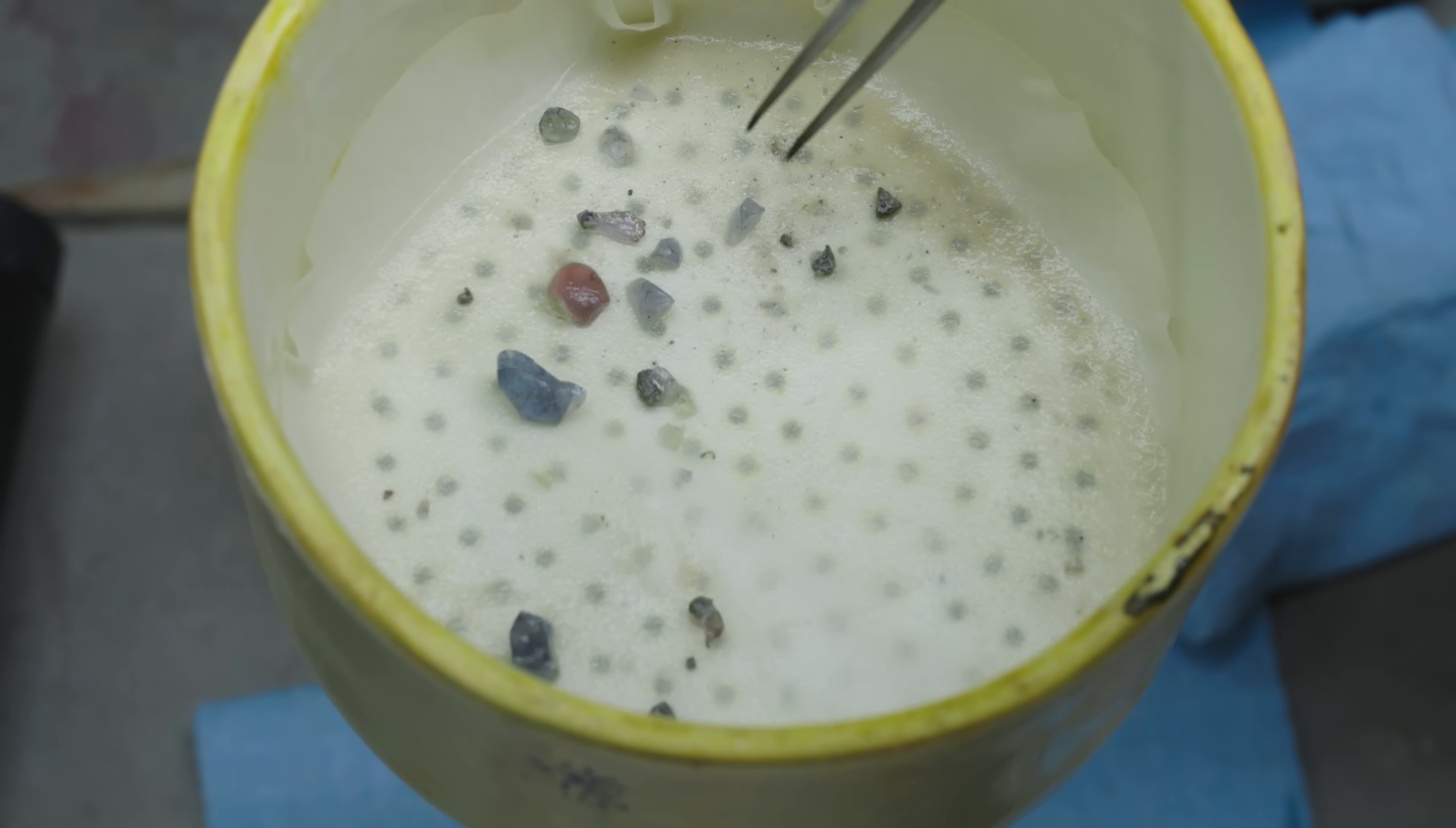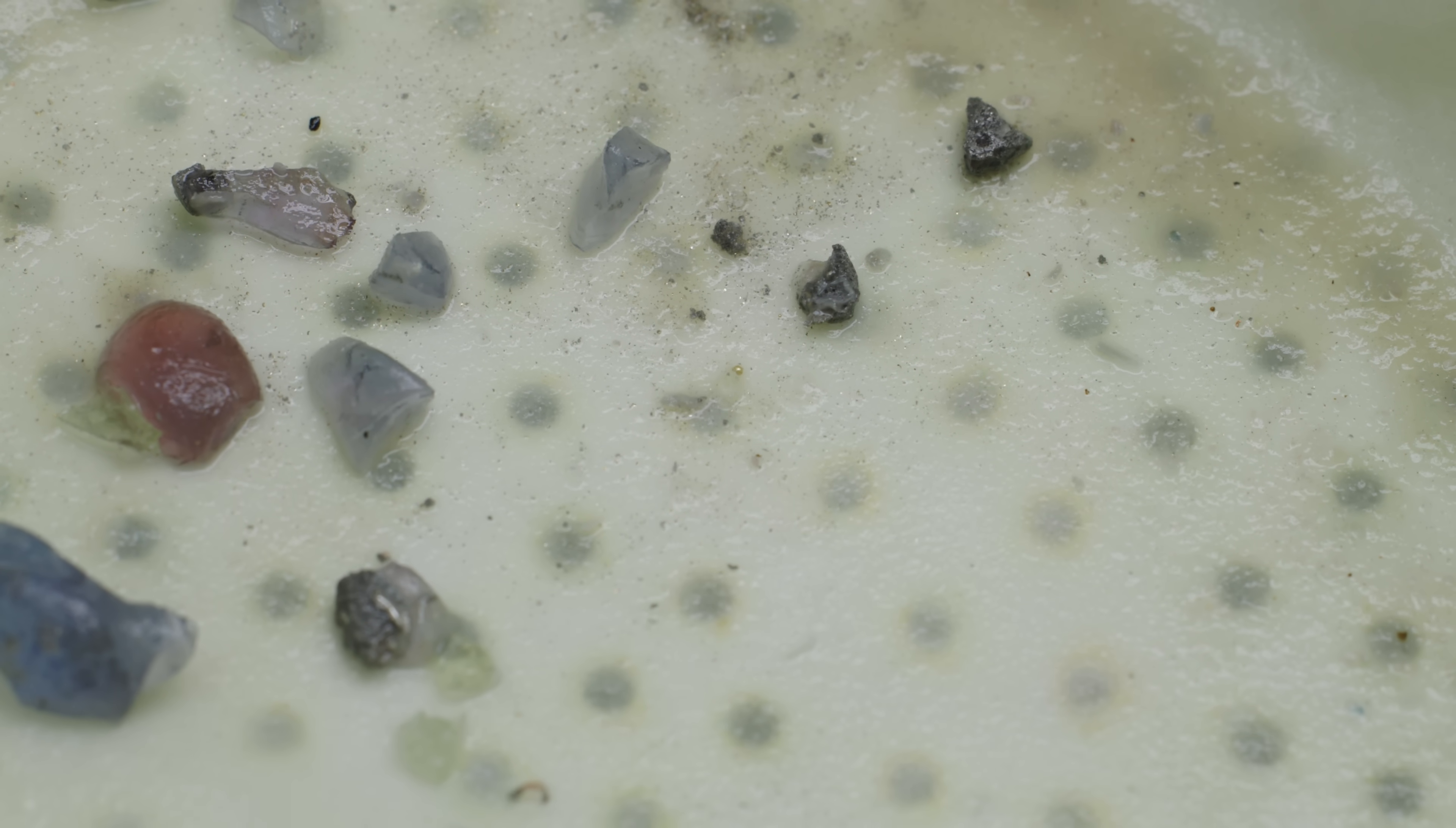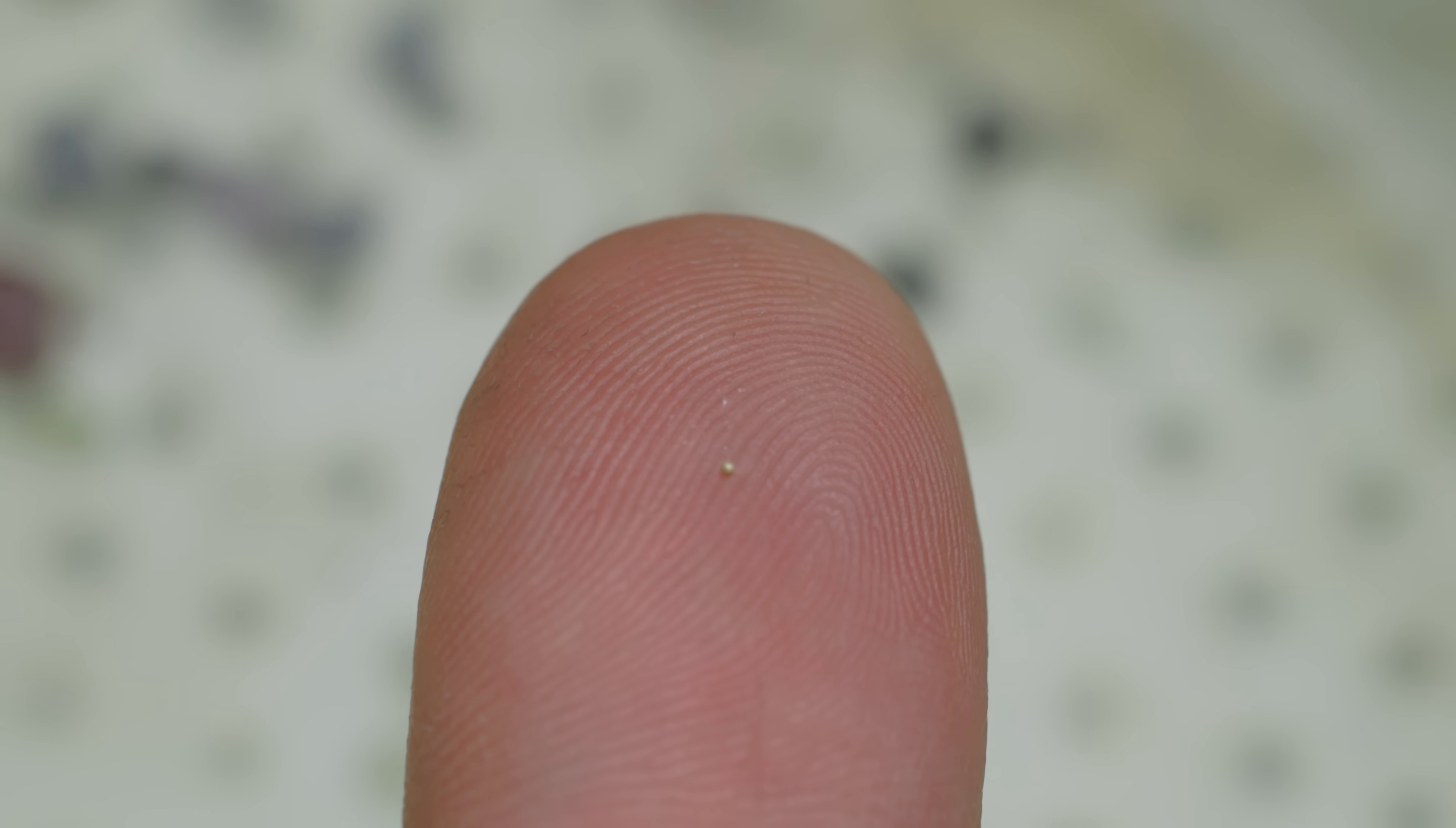And then something truly unexpected happened. What? There's a little piece of gold in there. Oh, there actually is some gold. Look at that. That is gold. What? That's right. I found the tiniest little piece of gold. This is so small that it won't even weigh on a scale. Oh man, that is hilarious. I'm going to try to put it on my finger. I mean, it literally goes in one of the grooves of my fingerprint.